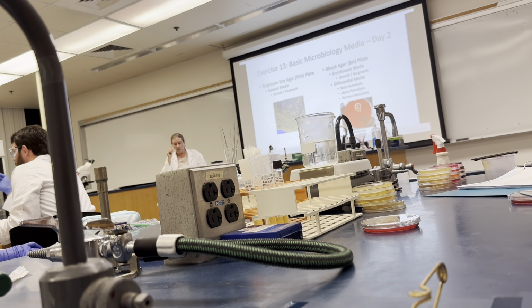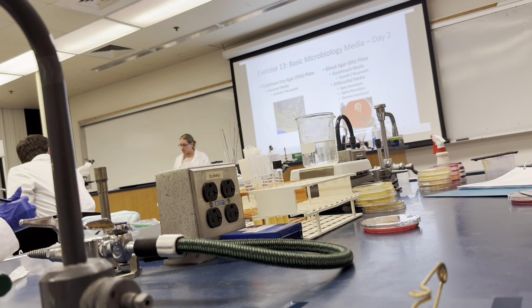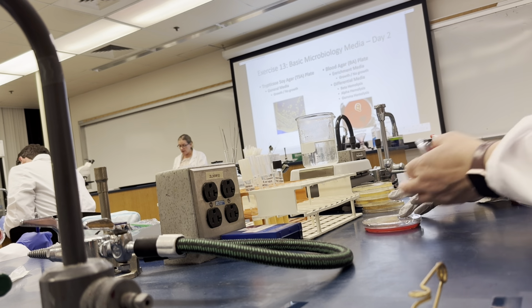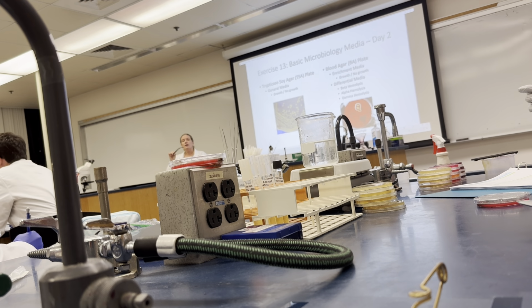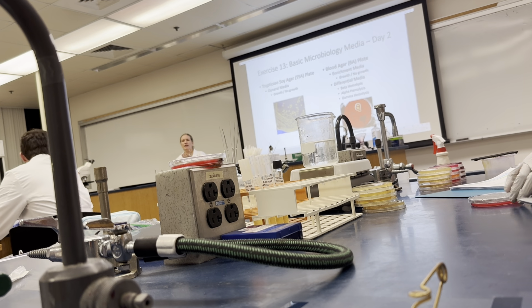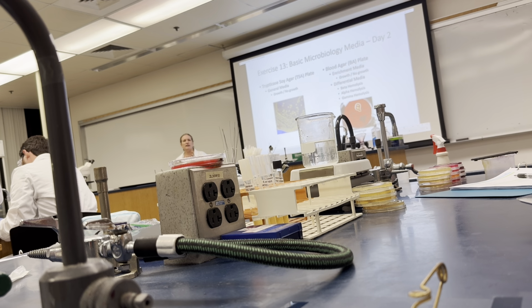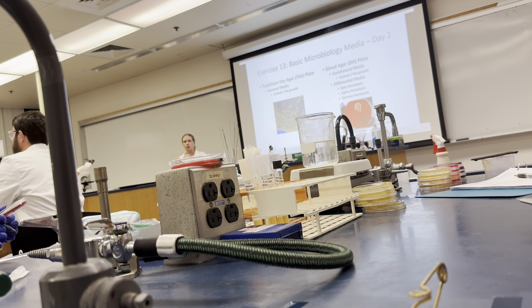Alpha hemolysis is where we have partial or incomplete hemolysis, and it produces a cloudy zone that's kind of greenish looking around that colony. Now, FYI, don't look for the hemolysis pattern in the area where there's thick growth, because the shadowing of the growth itself is going to give a greenish appearance. What you want to do is look at isolated colonies. Do they have a green halo?